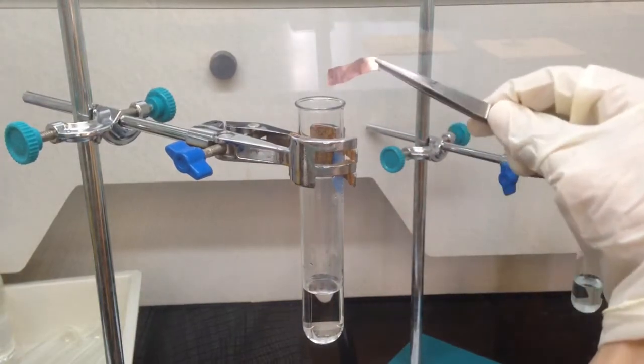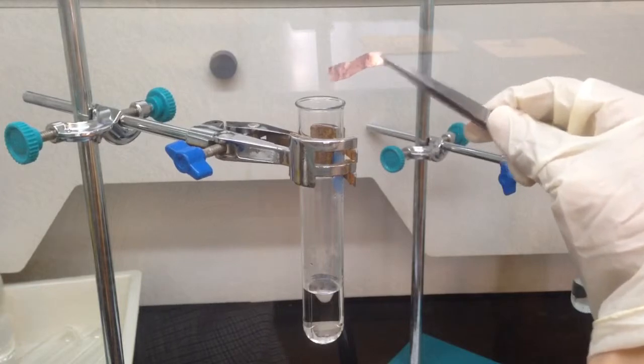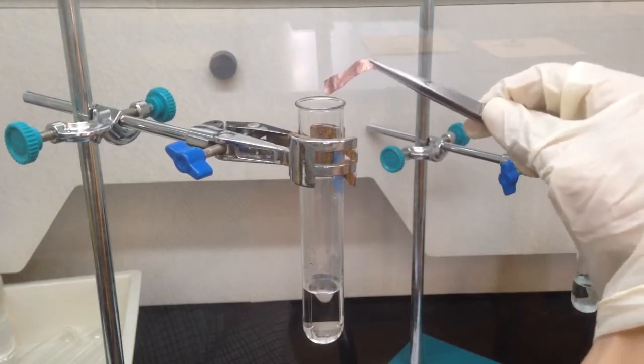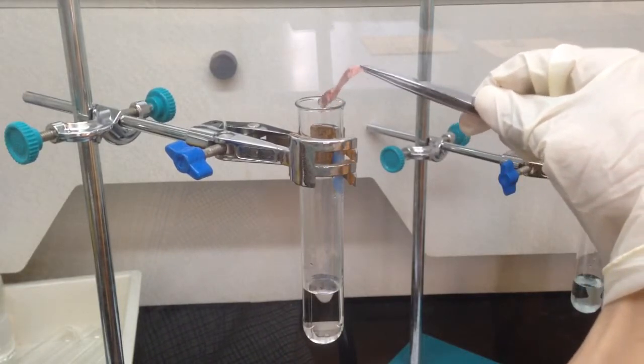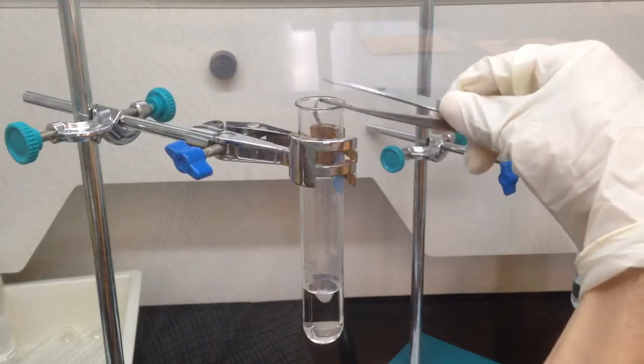I have a tube of nitric acid and I put a piece of copper into it now. Let's see what would happen.